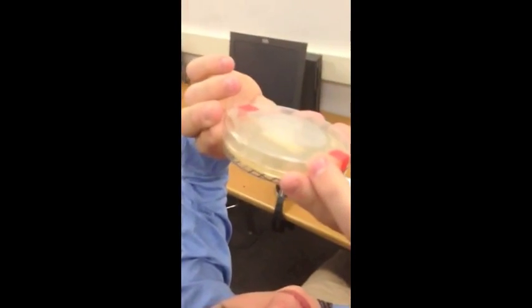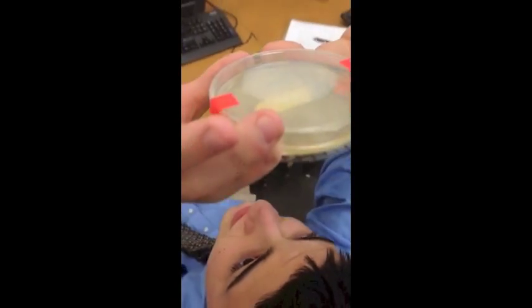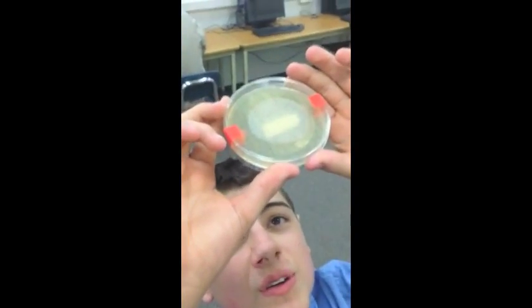At this point, Bryce is using the template to measure the bacteria growth of one of our petri dishes on the second day of growing. Here, again, he is doing the same thing on the third day of growth and again on the final day of growth.